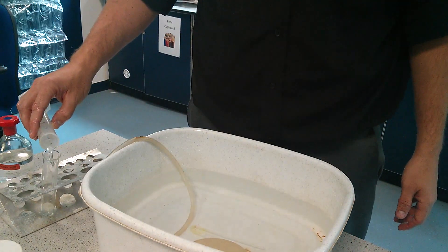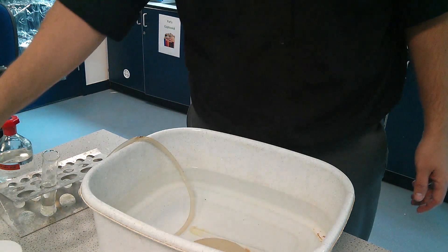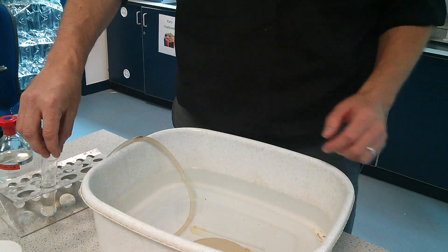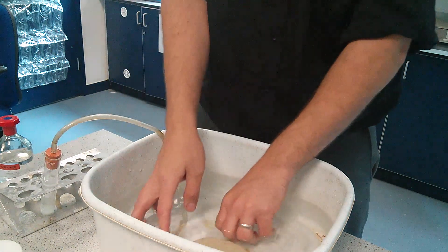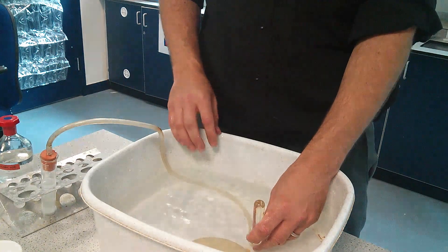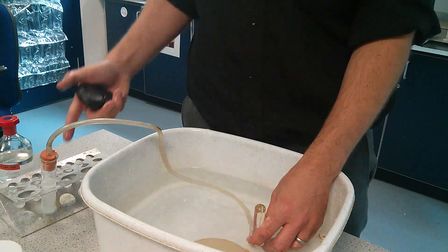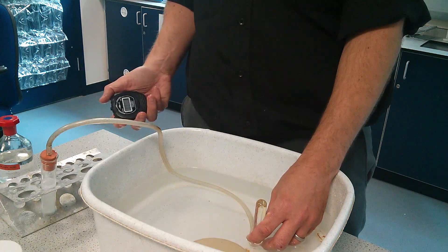Next, pour the acid into your boiling tube like that. Then take your limestone pieces and place them in, put the lid on, and put the gas delivery tube at the bottom. Start the stopwatch when the first bubble comes out at the bottom and starts to go into the test tube.